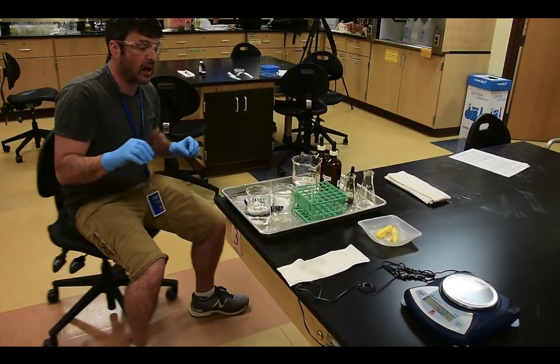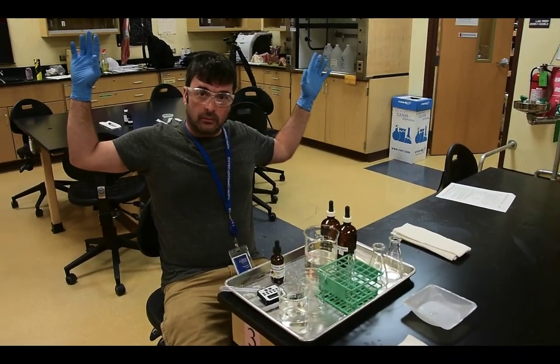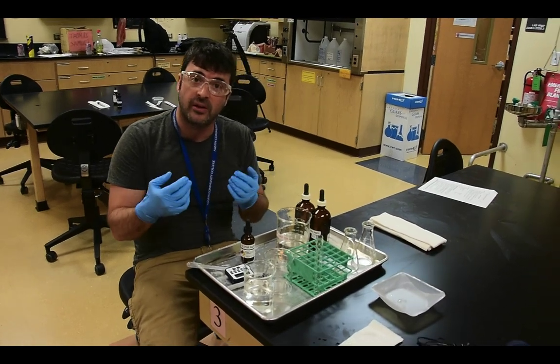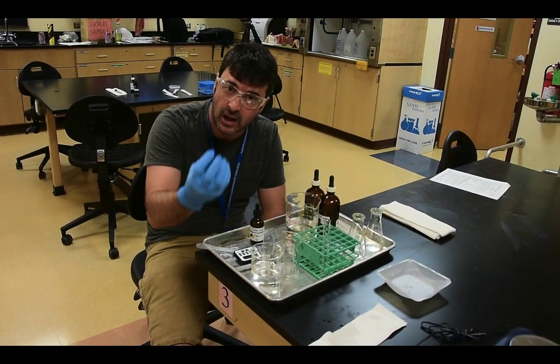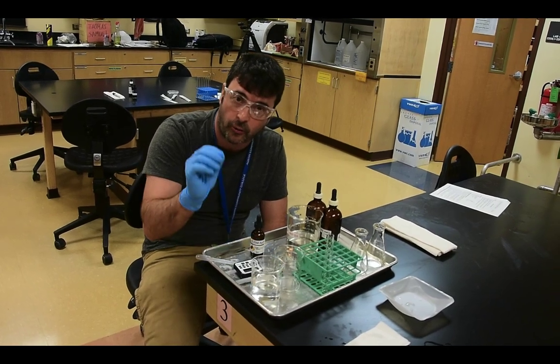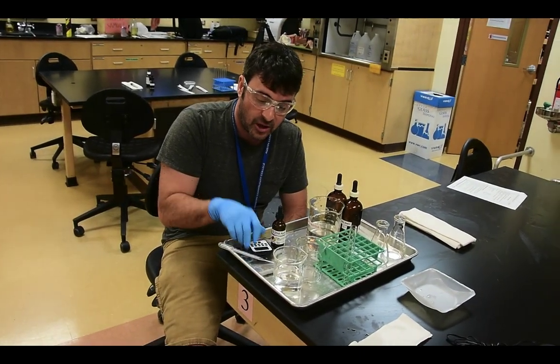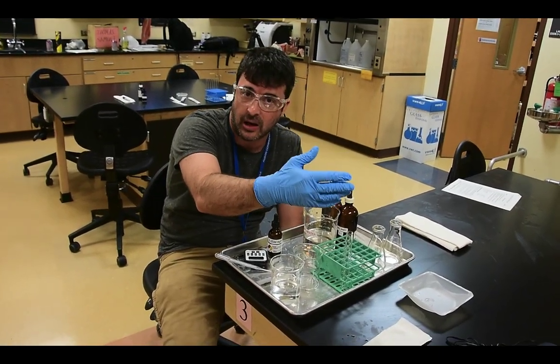Now, in the second set of lab questions, we're going to actually look at our solution. So we weighed our artificial cell before and after. Remember, inside the cell there was a 10% sodium chloride solution, and we soaked that artificial cell with that dialysis tubing membrane, that selectively permeable membrane, in distilled water for 45 minutes. So we used our timer. You can just enter 4500 and press start on it, and we set our timer and we waited 45 minutes. Then we took that cell out and we weighed it again.